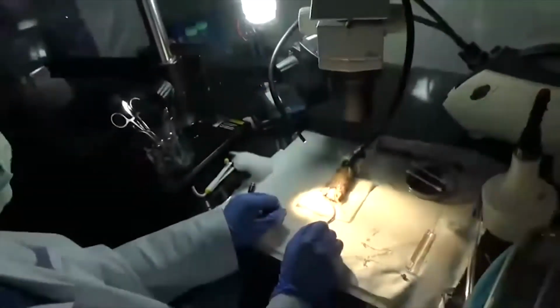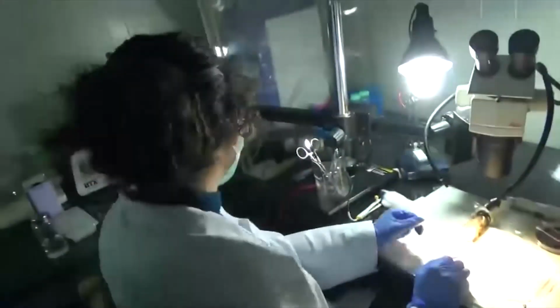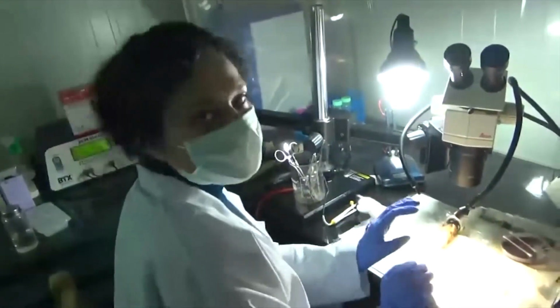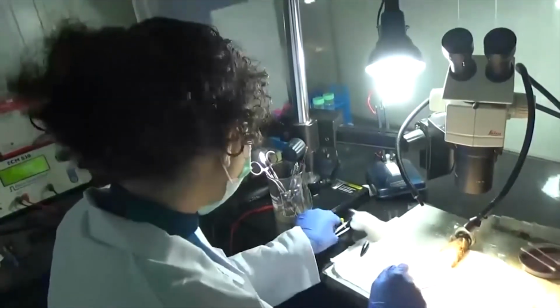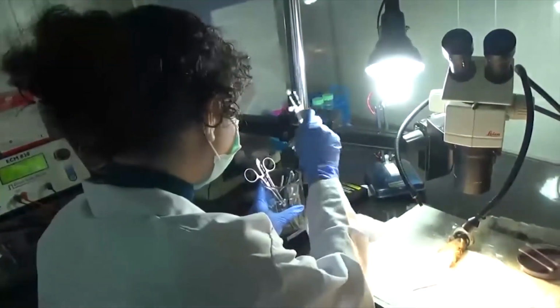Okay, can you zoom in a bit more to see that dye? Okay. So like this, we inject the transgene into the testis, followed by electroporation that involves giving 4 pulses of 60 volts each to both the testes, 4 reverse and 4 forward.